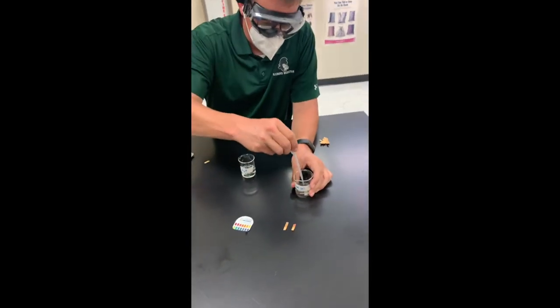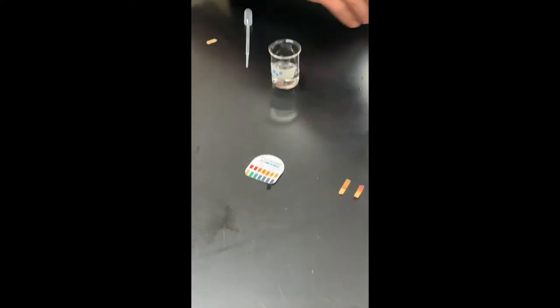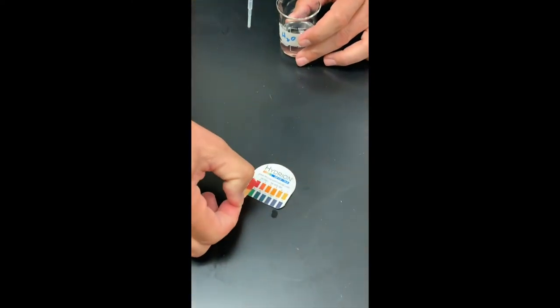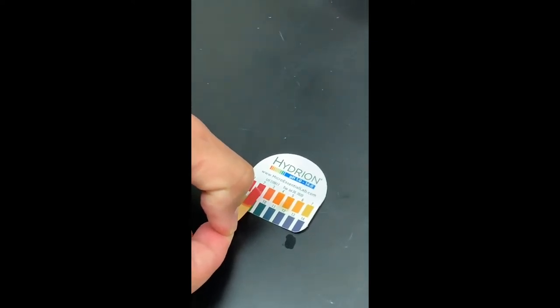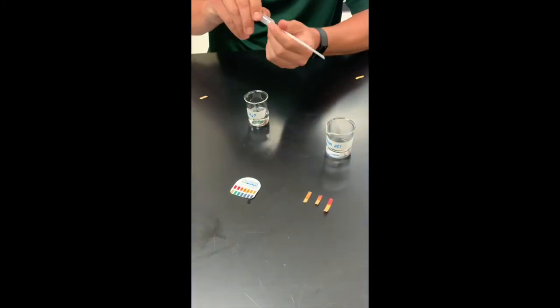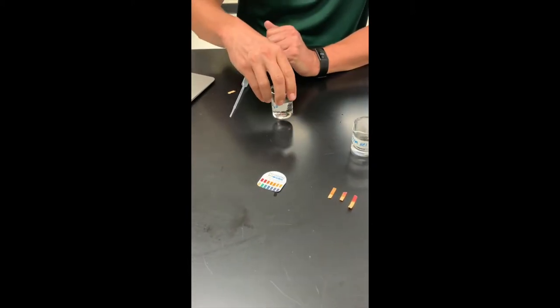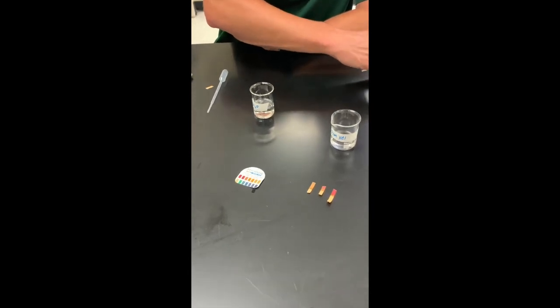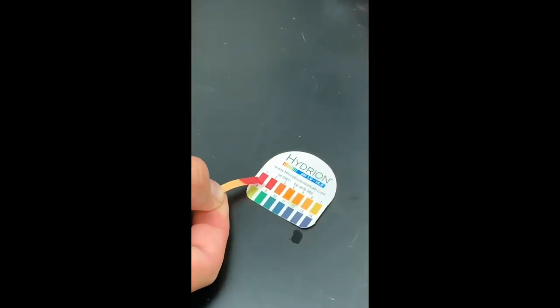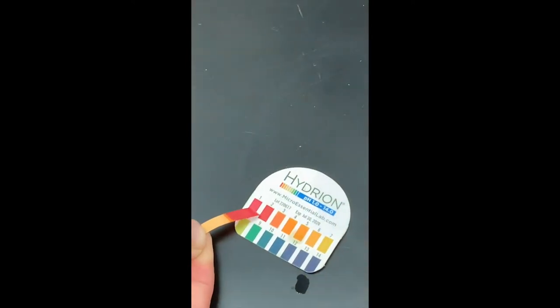Now we've got to add our second milliliter. Swirl it up and take the pH. Yeah, that's a two I believe. So we're going to take our third milliliter — swirl — and take the pH. And that's about a one and a half, somewhere between a one and a two.